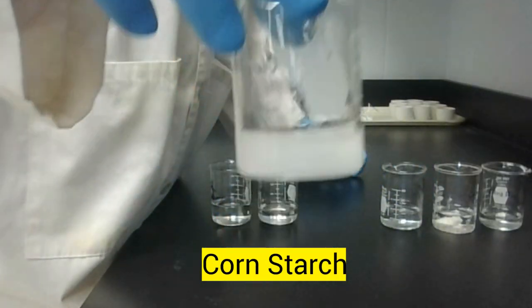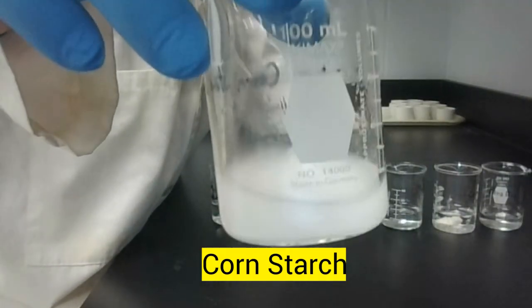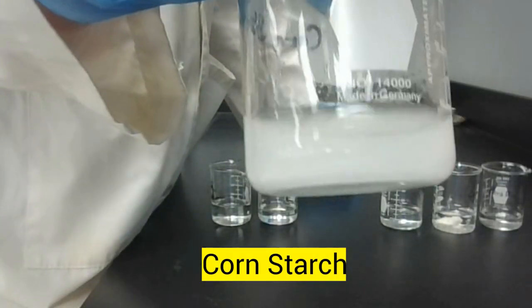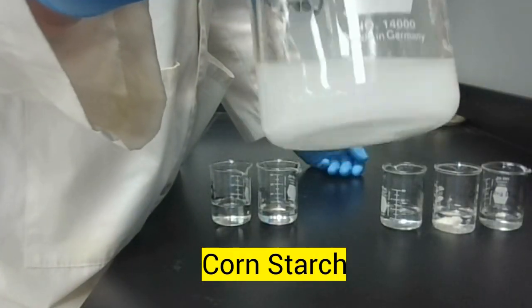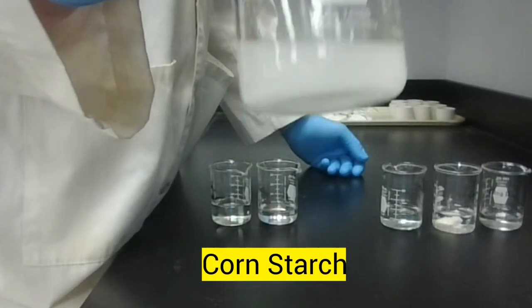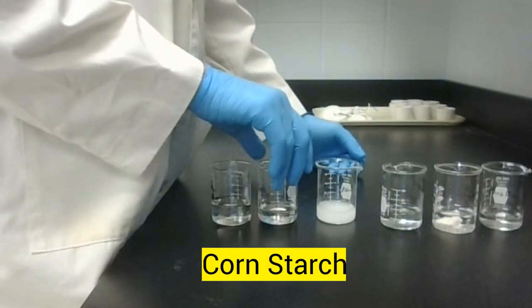Now, cornstarch is a little odd. Cornstarch disappeared, but it turned the solution cloudy. This technically did not dissolve. It just got dispersed throughout the liquid. So cornstarch, even though it's not still the powder that we saw, is insoluble. Didn't technically dissolve. It would have to be clear for it to dissolve.